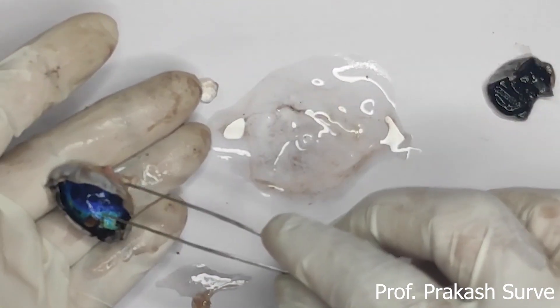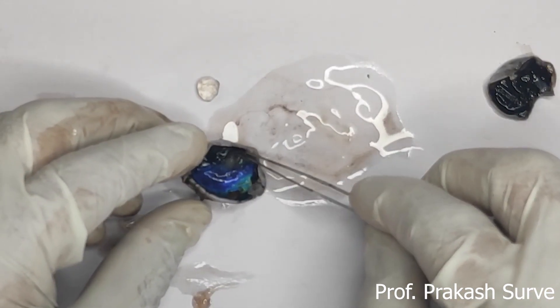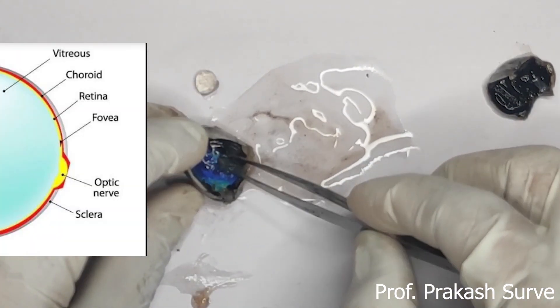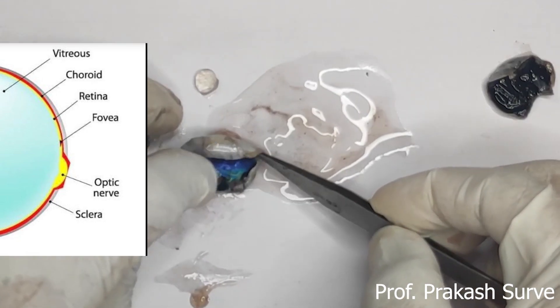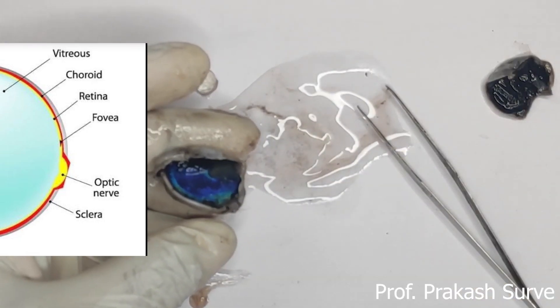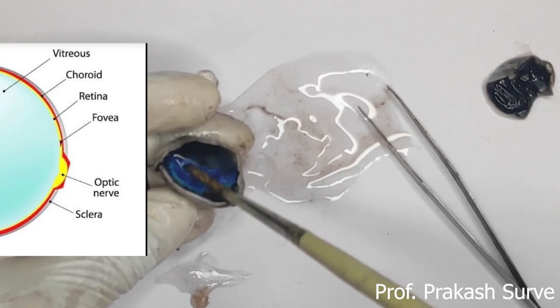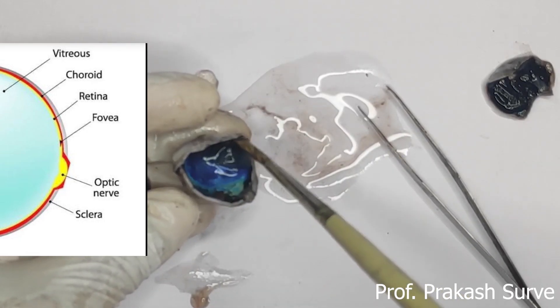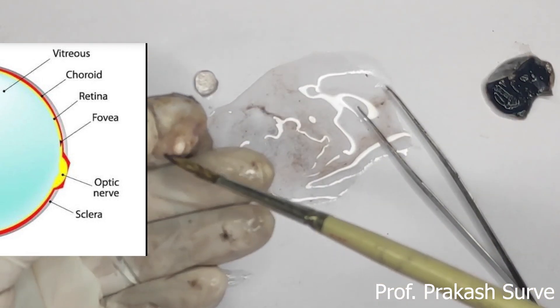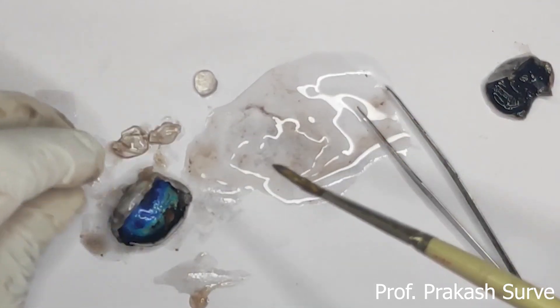The colorful structure we observe on the inner side is the retina. The retina is the innermost, delicate, light-sensitive layer. It shows a blind spot, located diagonally opposite to the lens, where the optic nerve and blood vessels leave the eyeball. The rod and cone cells lie deep in the retina.